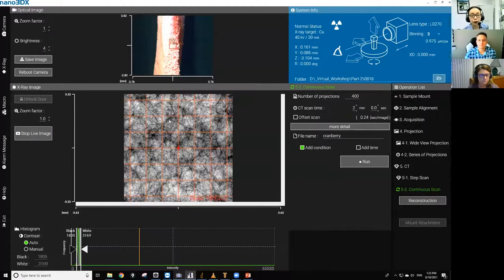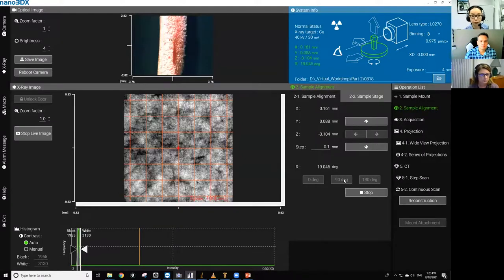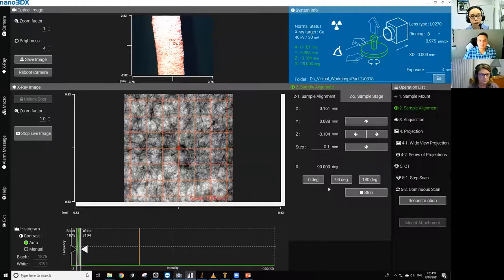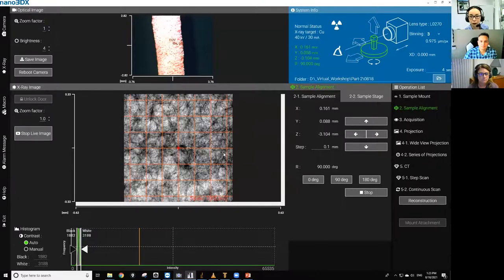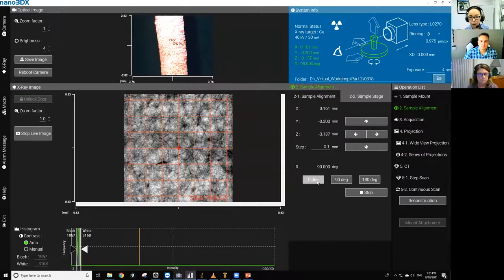Okay. So in this case, the sample is pretty big compared to the field of view. So I don't need to be too picky about the alignment, but let's make sure it's roughly at the center. Maybe a little bit to the left. Okay, going back to zero.